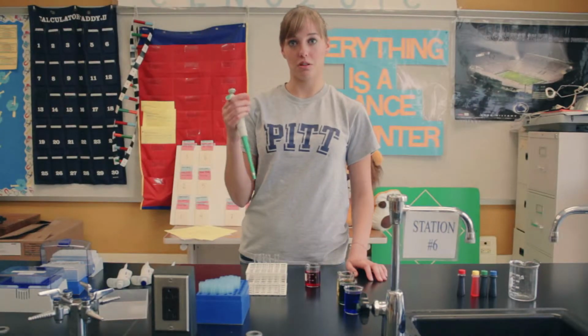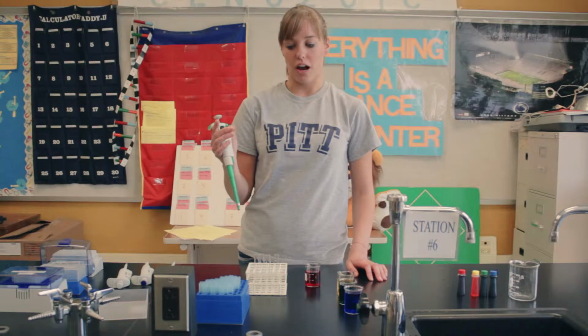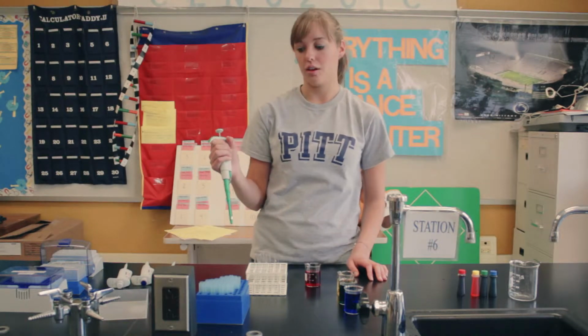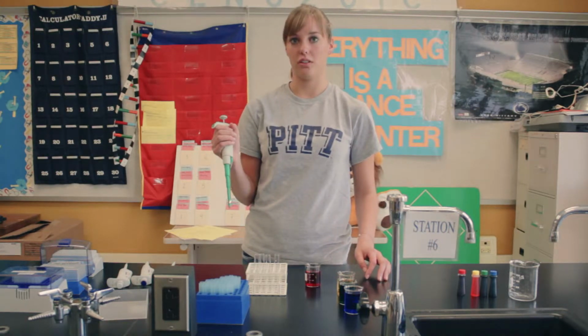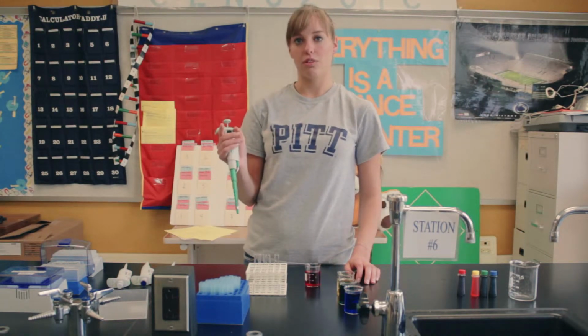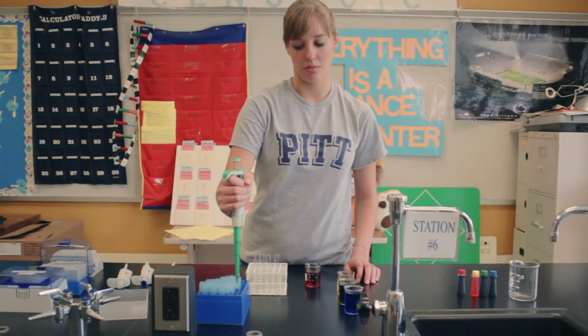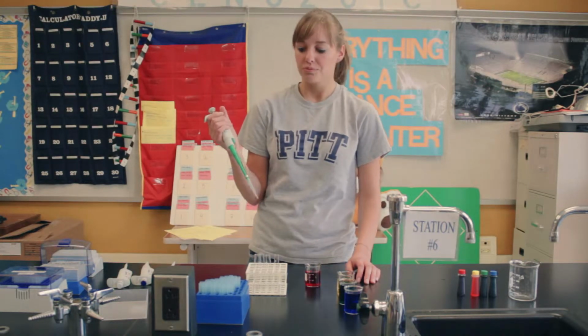I'm Maggie, and I'm going to show you a demonstration. First, I'm going to start with the BioRad, and the first thing you have to do is get a tip, which are all located in boxes and labeled boxes. And you just have to find the one for the BioRad. And to get a tip, you just need to stick the micropipette in, push a little bit, and pull out.